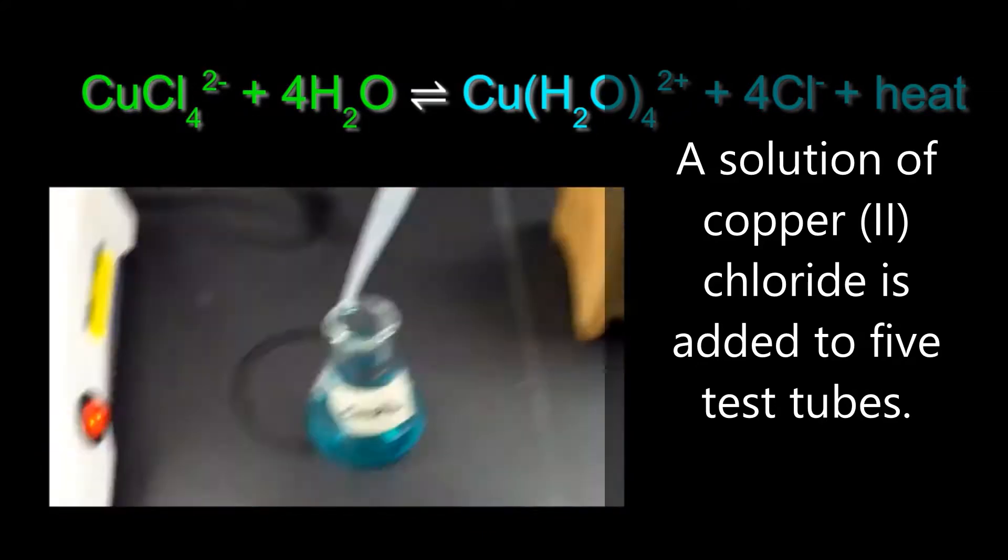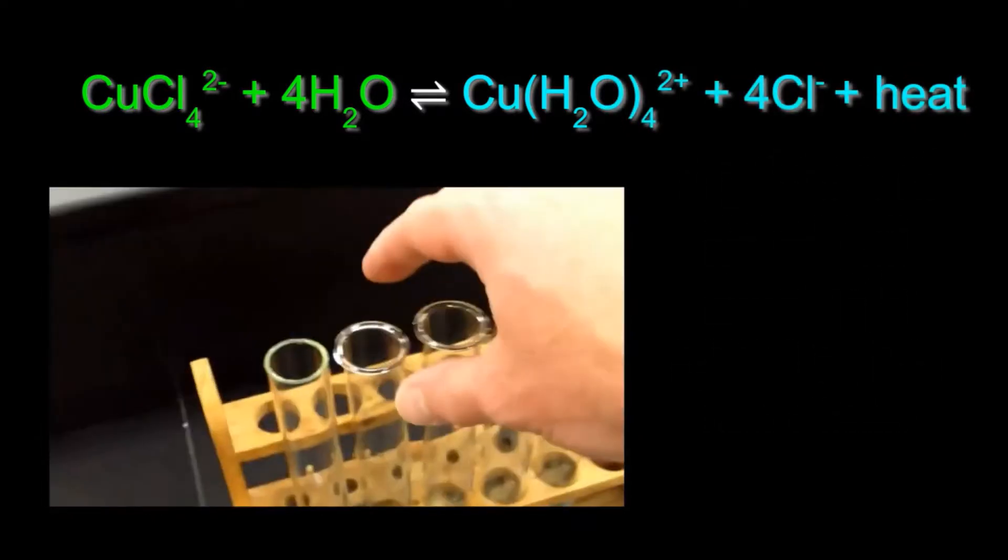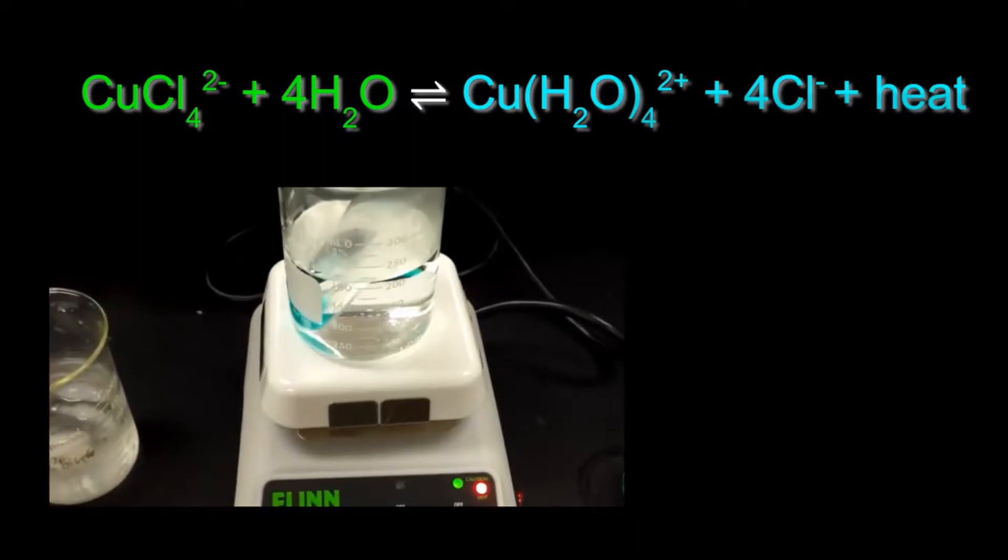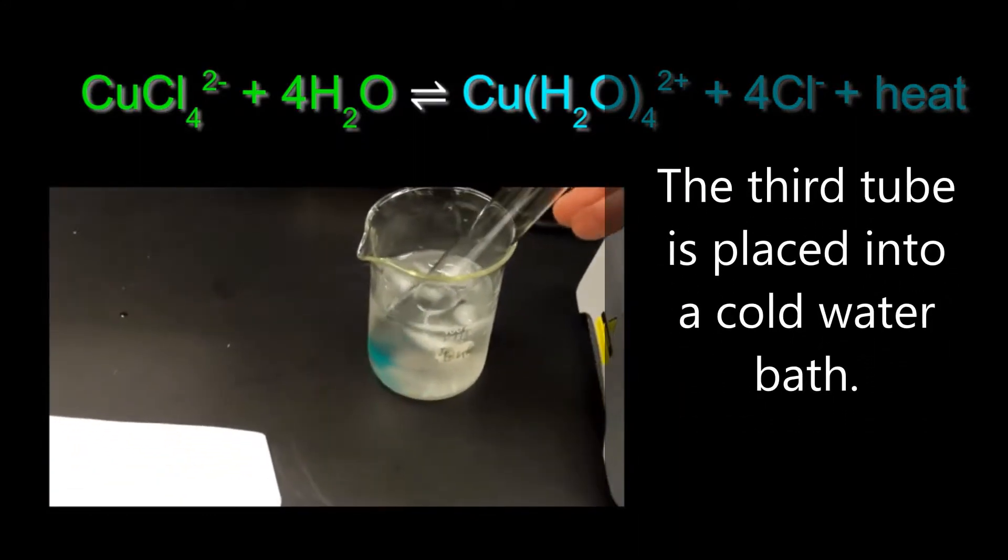The experiment is set up by adding a solution of copper chloride to five different test tubes. The second tube is going to be placed into a hot water bath. The third tube is placed into a beaker filled with an ice water bath.